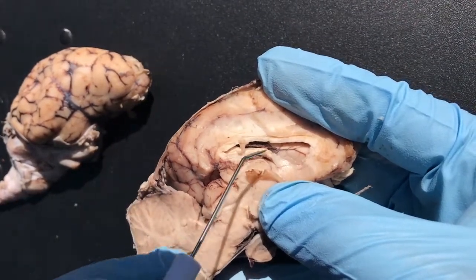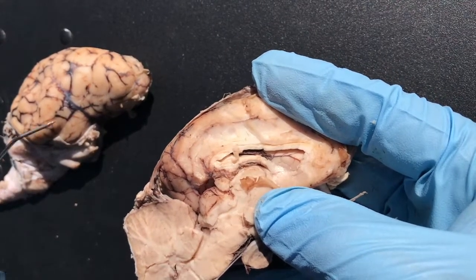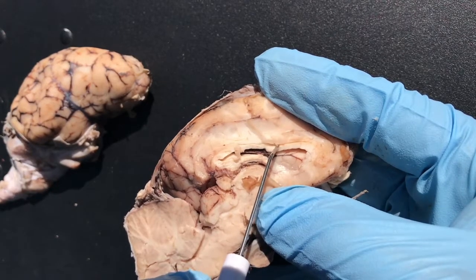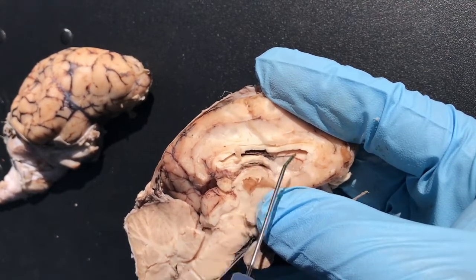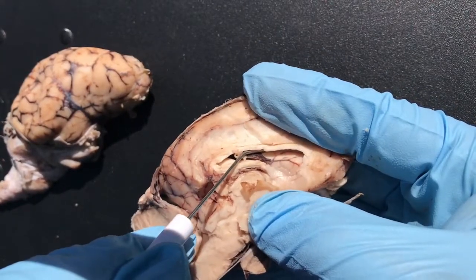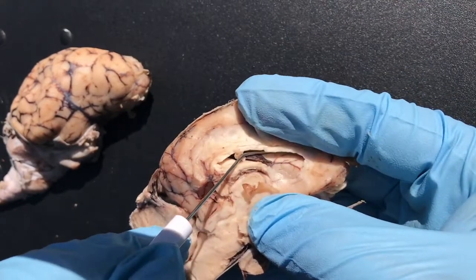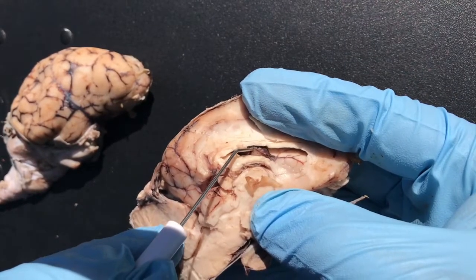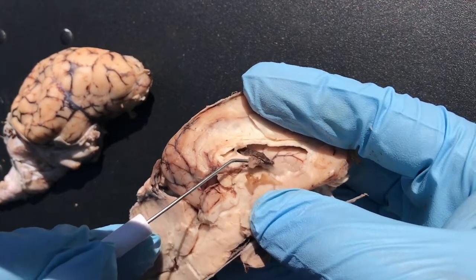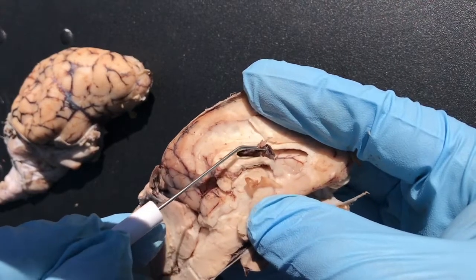That's what connects the left and right hemispheres. When a child is able to draw a complete circle, the corpus callosum is completely formed, allowing the left and right hemispheres to communicate. And inside then you have your cerebrospinal fluid, and this cavity is called the lateral ventricle. You can also see the choroid plexus here — this bloody mass here, choroid plexus.